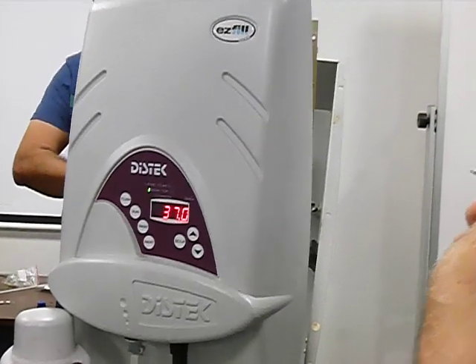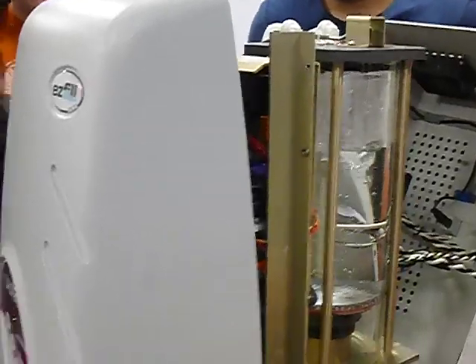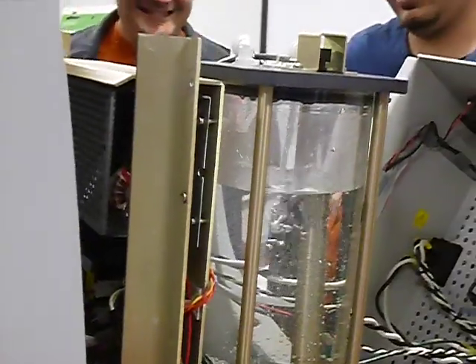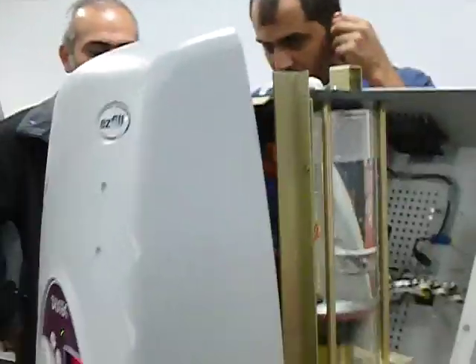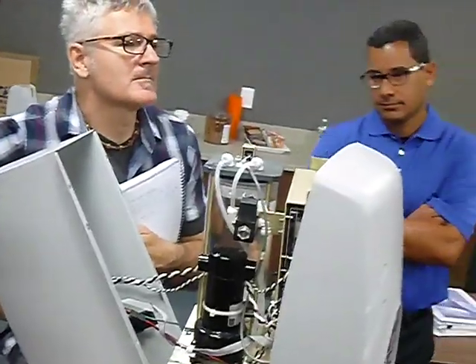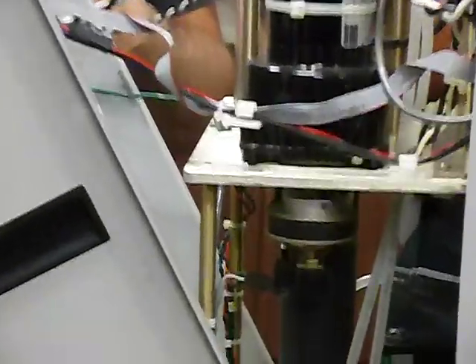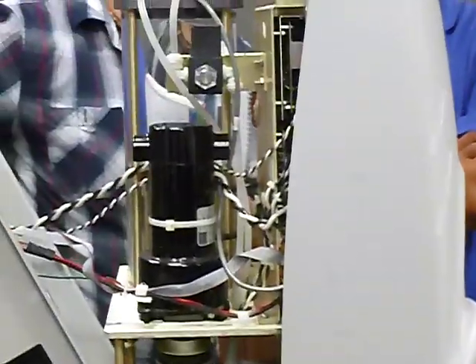You know, when my colleague exchanged this O-ring, he didn't look well, and those cables were beneath the glass. When the customer switched it on, boom. I had so many issues with puncture on one of these tubings, because of some pressure issue. Usually, what I found out was the main board. What happens is the heater's heating up and it gets so hot that it evaporates the water, and then it becomes pressurized. What does water become when it gets too hot? Steam.